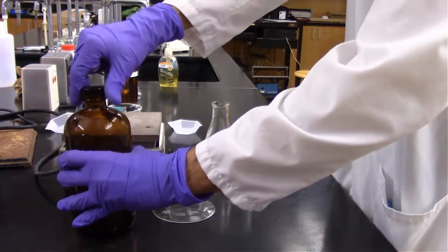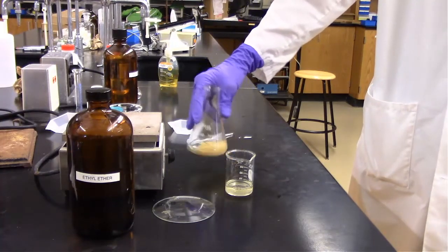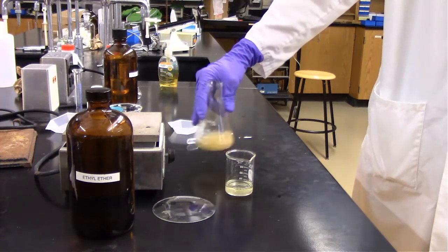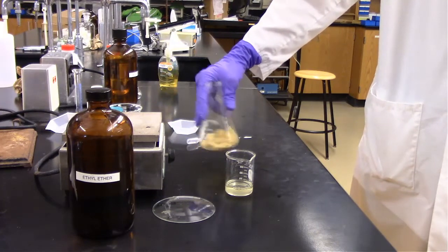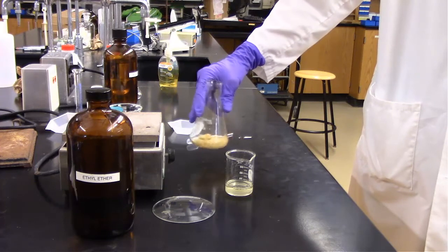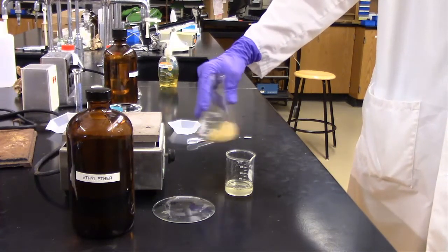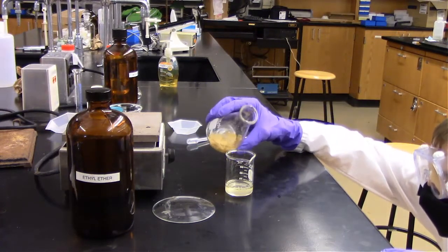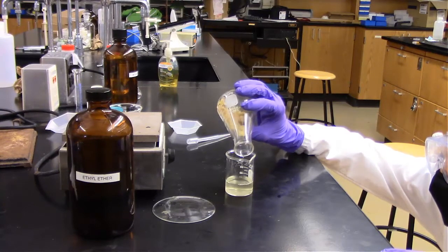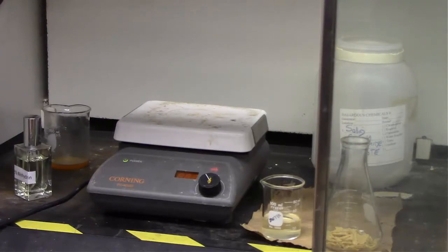And now we're on the third extraction. Notice that I put the cap back on the ether for the last two, I forgot on the first unfortunately. This is the final extraction where we're going to try to get all of the fat extracted. And finally now we're decanting very carefully, and hopefully none of the chips will fall, but we definitely need to max out what we're decanting from our Erlenmeyer flask. You saw them slide there, that's why we're using an Erlenmeyer flask though because it's got essentially a rise up before it exits out, which kept those chips from falling.